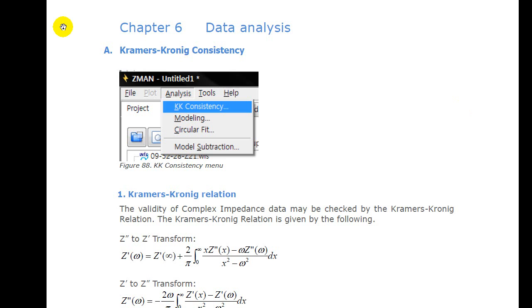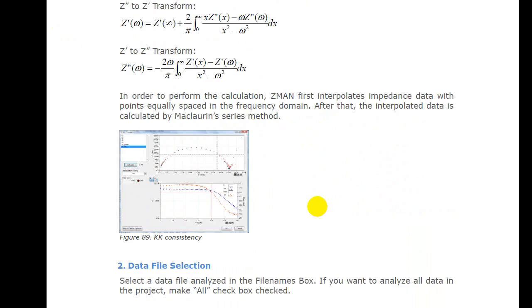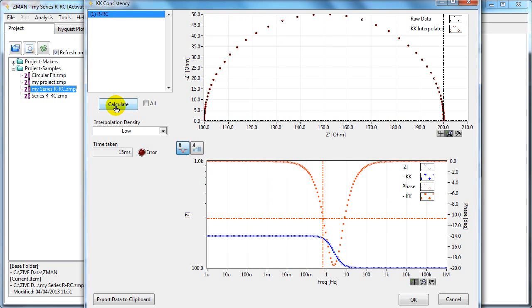The KK consistency is described in Chapter 6 of the ZMAN software, and it also lists the equation that it uses. In the ZMAN software, you should choose the interpolation density, and when you're ready to run, you click Calculate. This is the time taken, and if an error has occurred, this will light up. You can see in the plots now, the KK interpolated data has appeared.